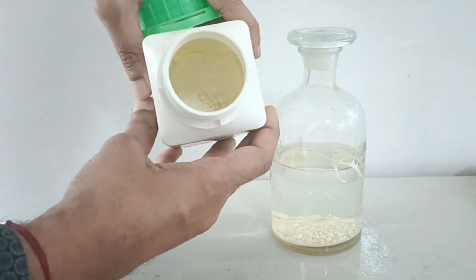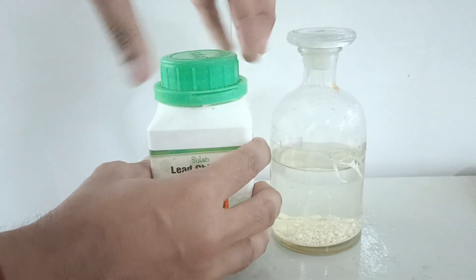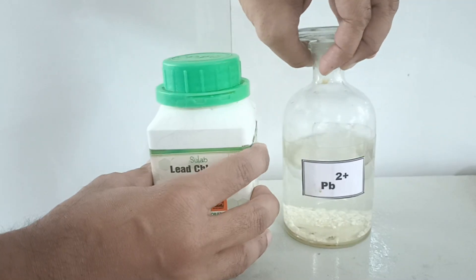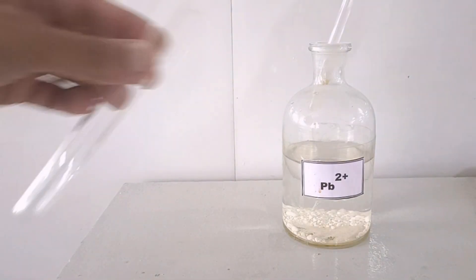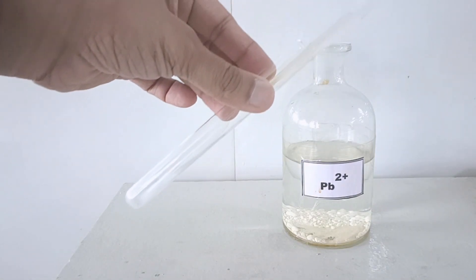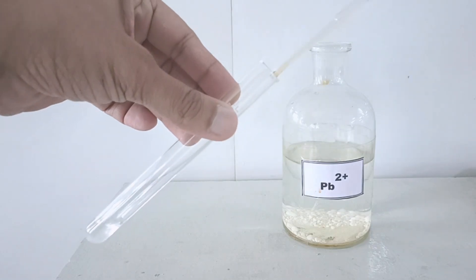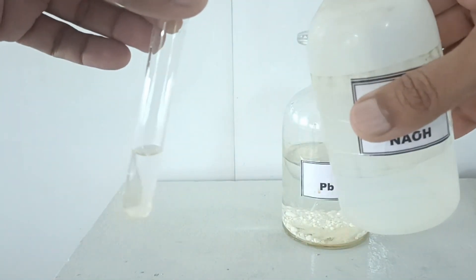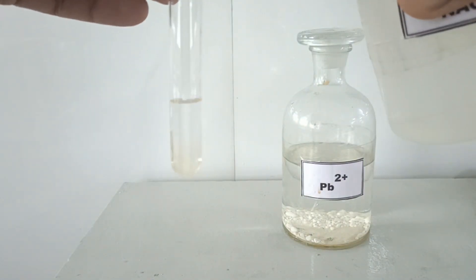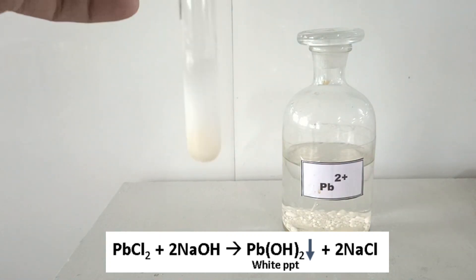Let's take up the first salt, lead chloride, which is white in color. Here I have its solution, prepared by adding water to lead chloride salt. You can see that it is partially soluble in water. We will take some amount of lead chloride solution into the test tube, and using a dropper we shall add about 1 ml of sodium hydroxide solution. Immediately, white colored precipitates are formed.